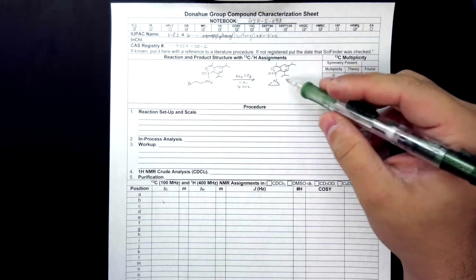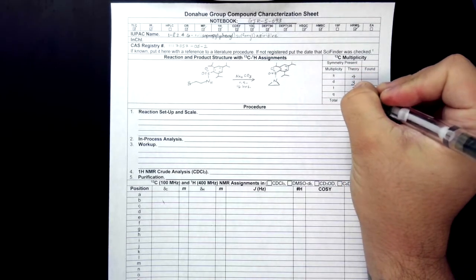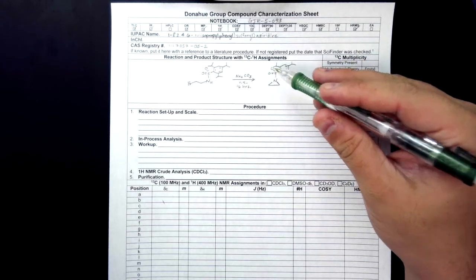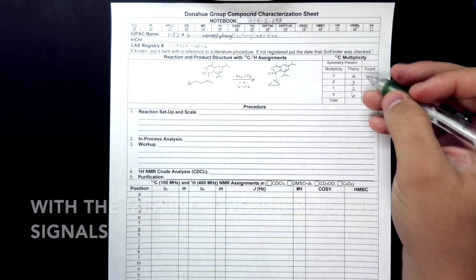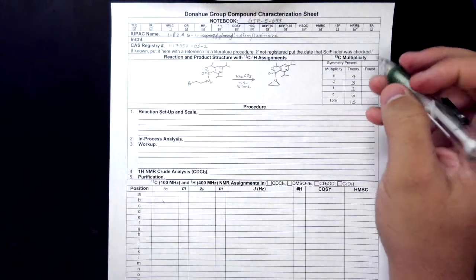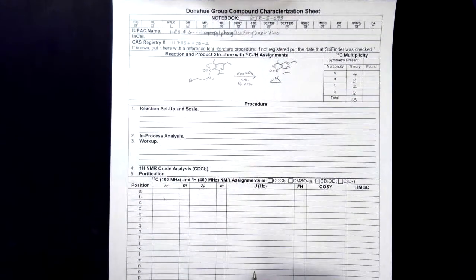Triplets, we don't have any up here, but we do have 2 down here. And quartets, 1, 2, 3, 4, 5, 6. And then we add that all together for 15. We'll come back to this section after we fill out more of our paper, but for right now, that's all we're going to do on that section.